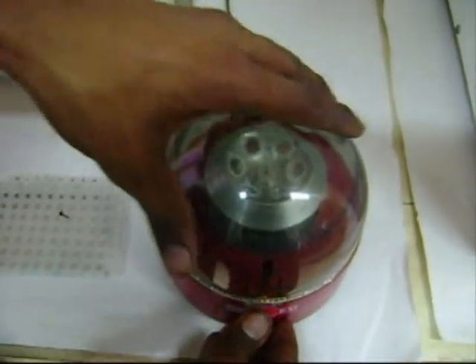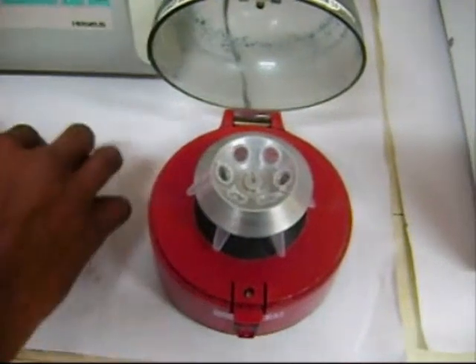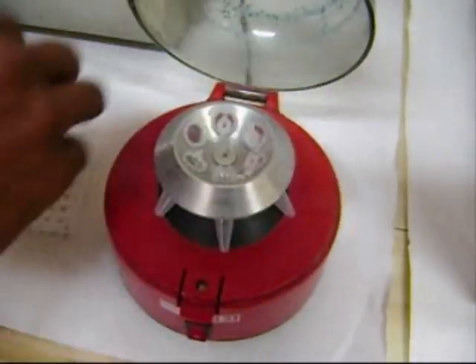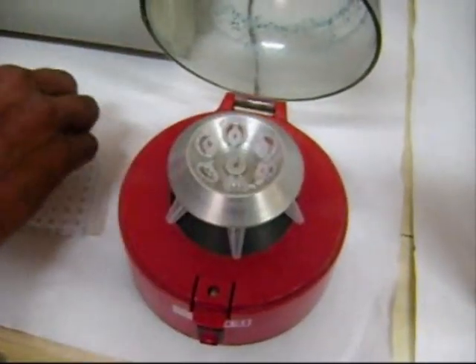As all the components of the PCR cocktail are added to the walls of the PCR tube, it has to be allowed to spin for 10 seconds to mix all the components well and to bring the mixture to the bottom of the tube.